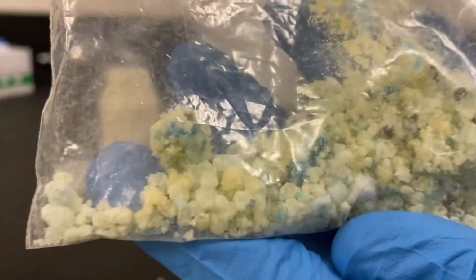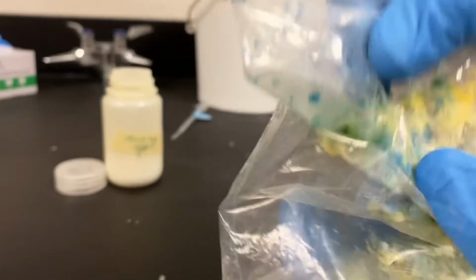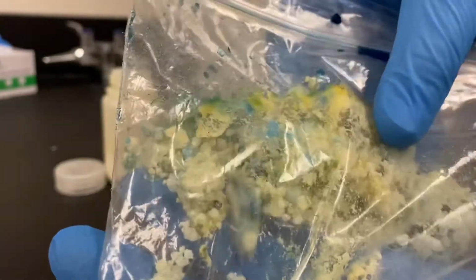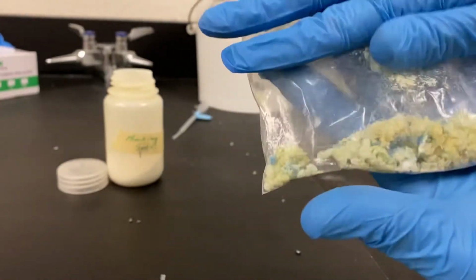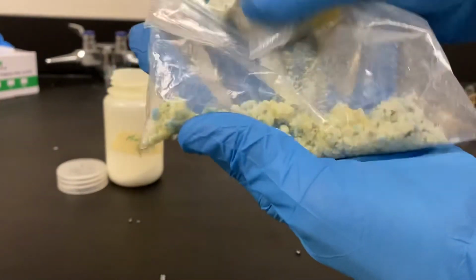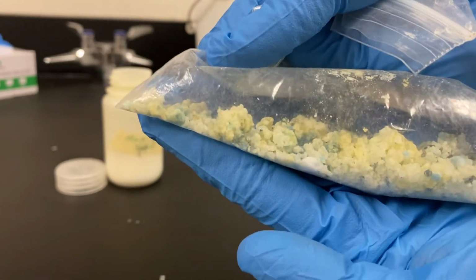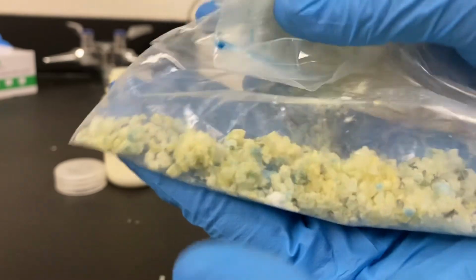That's your last block at the very bottom of your table. So to get it all in one spot for you, see kind of that mess in the middle. You should still be able to hear some little fizzing sound. And also, if I take a look, I was very good at getting rid of all the air. And now as I show you in my baggie, there is actually air in there now. And I was pretty sure that I emptied it all out at the beginning.